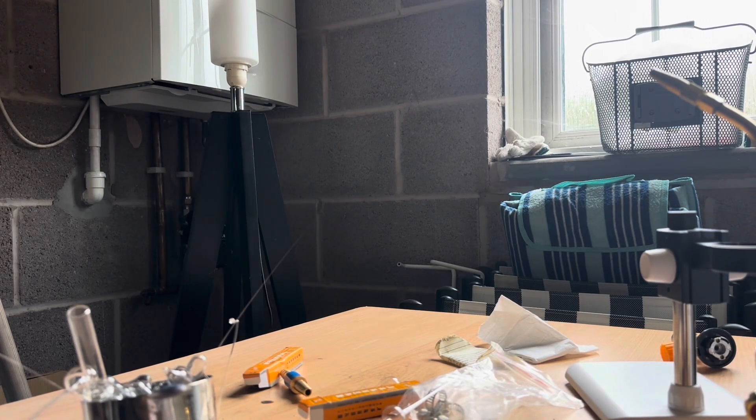Hello, welcome to another of my new video. In today's video, I will be explaining you how to cut glass tubes.